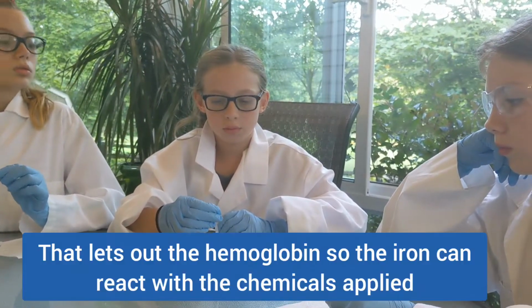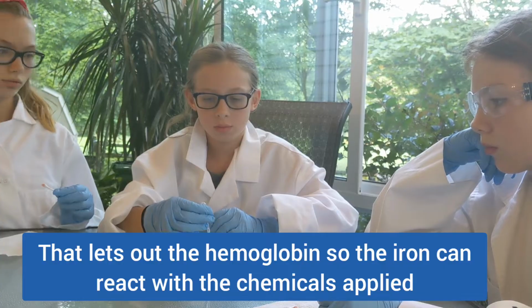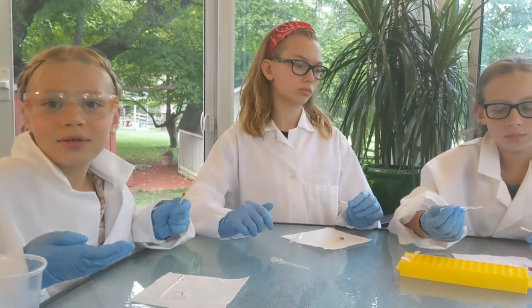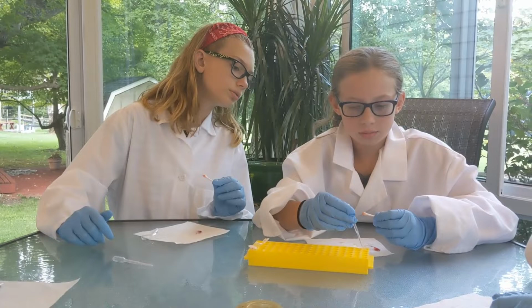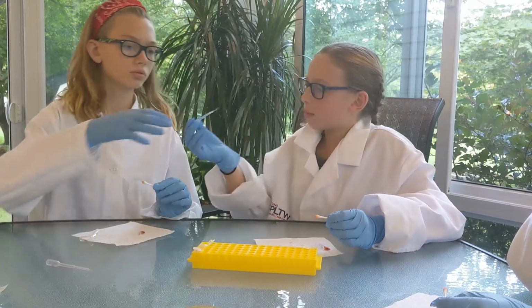If it's real blood. Yeah, but to detect it, we have to get the iron out of the cells by breaking the cells open. So think about a balloon. We're going to pop the balloon. If you take the iron out, you can detect it. And the color will change. So just add a couple drops, Taylor, and then pass your pipette. Make sure it doesn't touch the swab so that you don't contaminate the pipette with your sample.